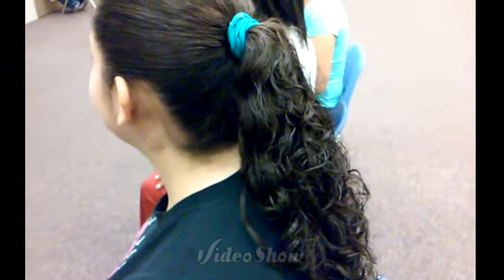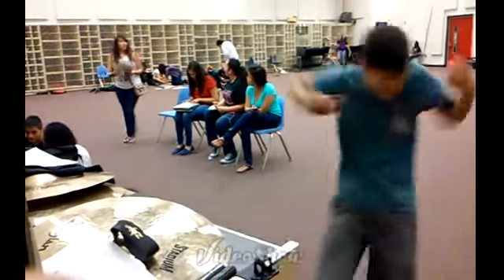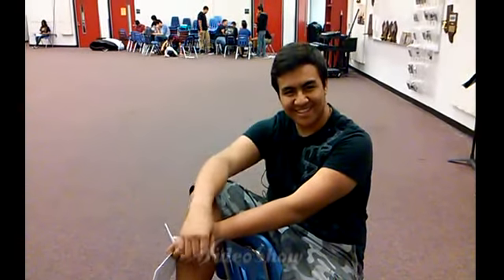During a lab experiment, you have to keep your hair back in a ponytail in order not to damage hair with chemicals. This is why you don't touch hot things. Oh, Dad! Oh, what happened? And this is why you don't wear open-toed shoes during a lab.